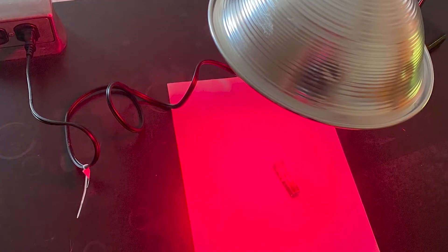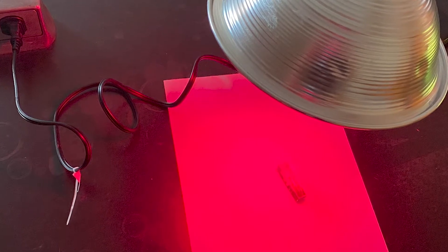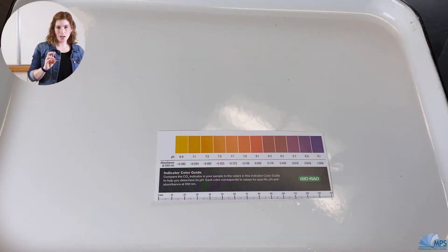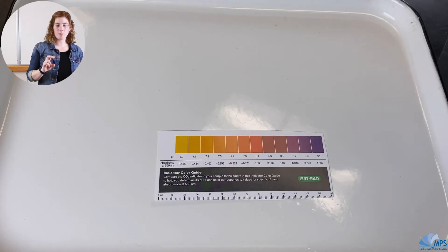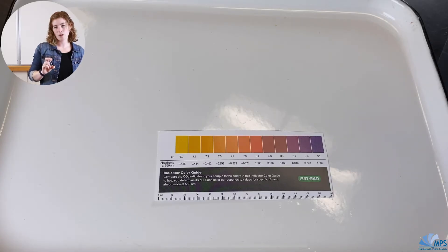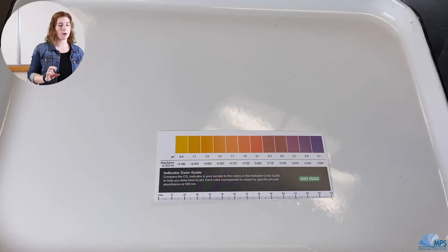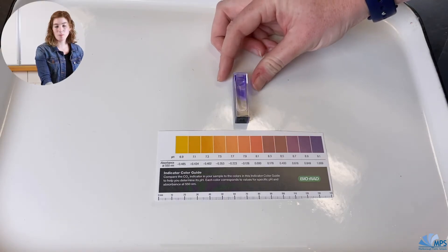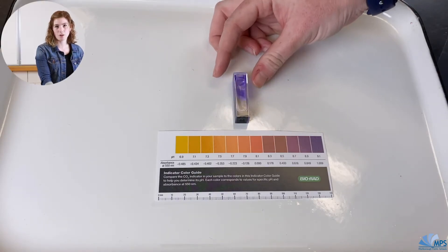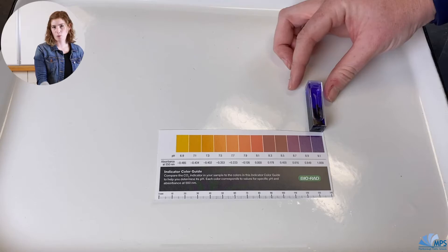Next we'll take a look at the red light — what happened when I put my plants under a red lamp. Keep in mind the chlorophyll in plants: what makes them look green helps them absorb colors like red and blue, and it actually reflects colors like green. So under a red lamp I would expect it to absorb lots of light. What I see is almost the same deep purple color as under the white lamp, so my pH under the red light is also 9.1.